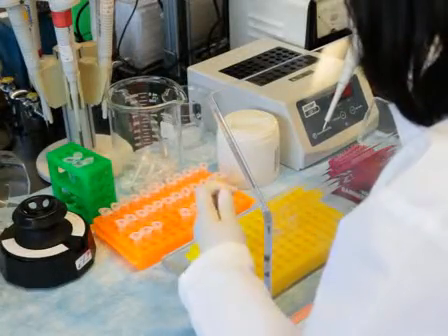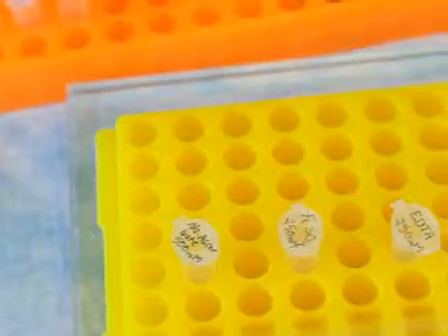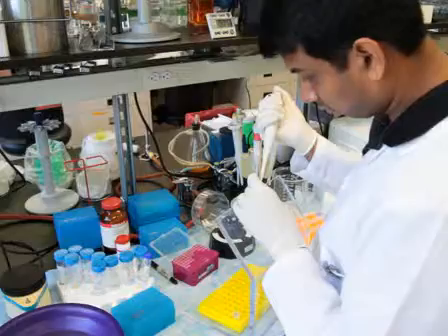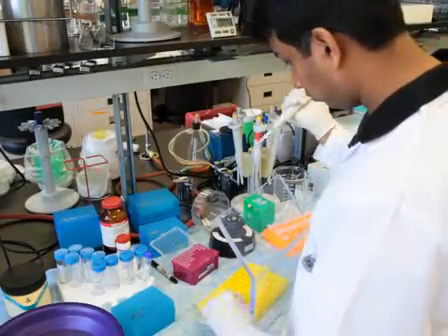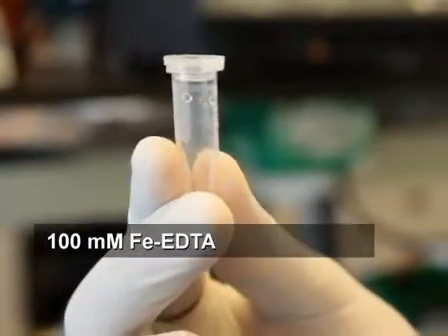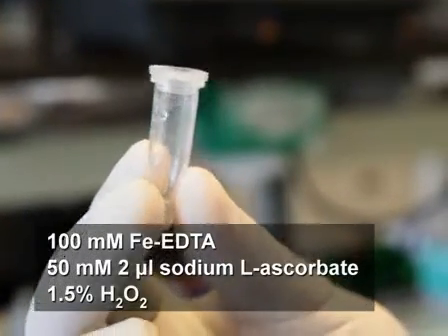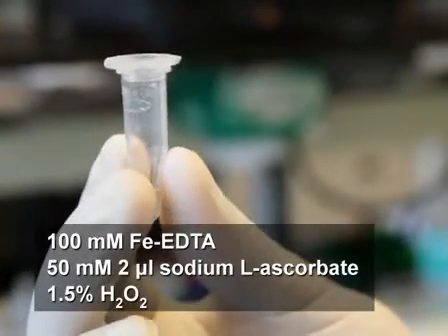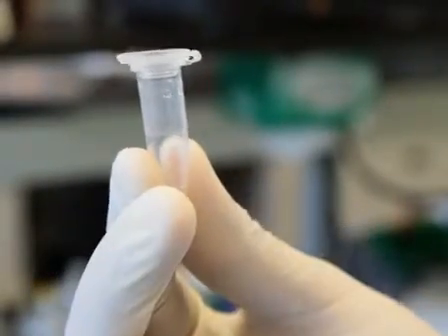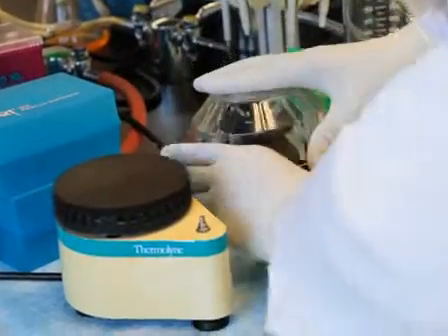Meanwhile, immediately before initiating the hydroxyl radical footprinting reaction, prepare the Fenton reaction mix as described in the written protocol. Prepare the peroxidative reaction by pipetting 2 microliter droplets each of iron EDTA, sodium ascorbate, and hydrogen peroxide at the top inside of the reaction tube containing the RNA solution so that the droplets are not touching. Start the footprinting reaction by vigorous mixing.